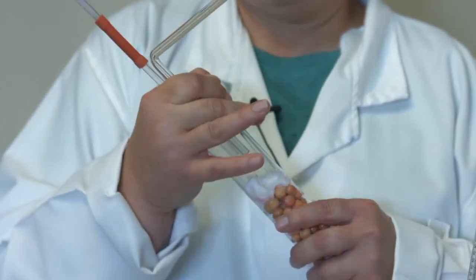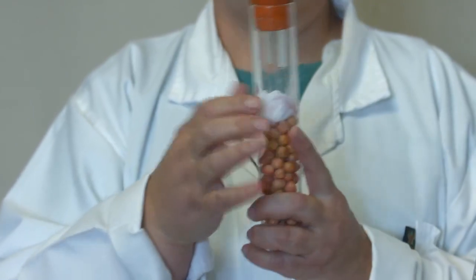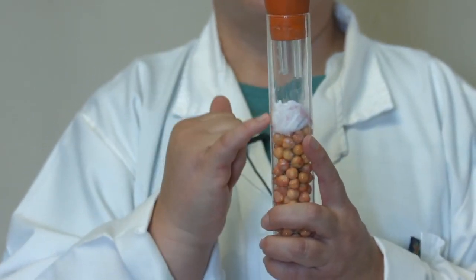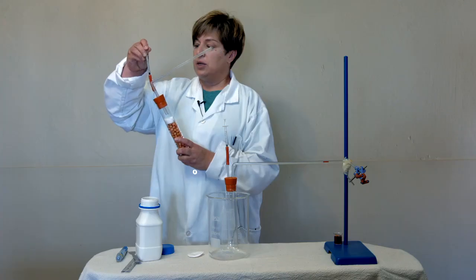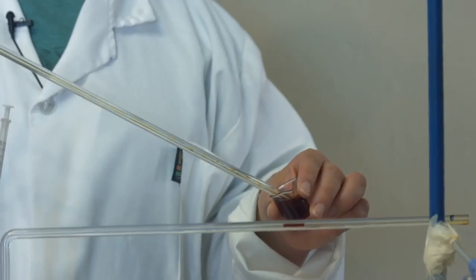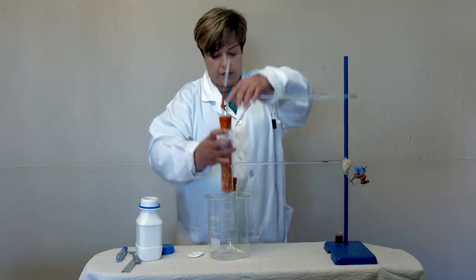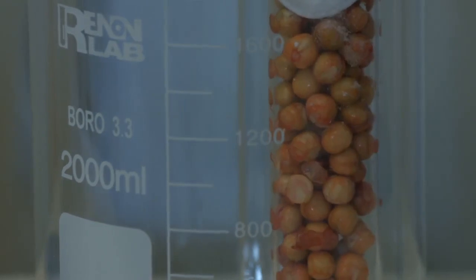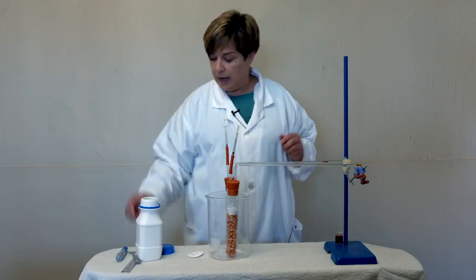And when we set up the experiment, it is very important that we make sure that these tubes sticking out at the bottom do not touch our pea seeds and the soda lime. And then we are going to use our plunger, and we are going to take in a droplet. Just as before, we are going to put it down because we don't want to transport too much heat from our body onto our tube so that we have movement due to the heat.